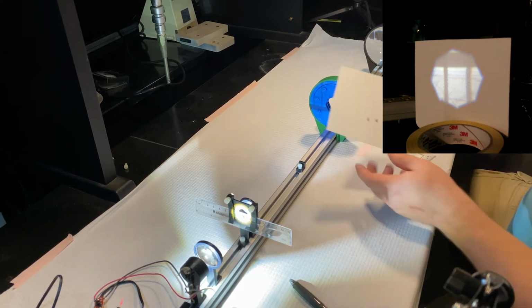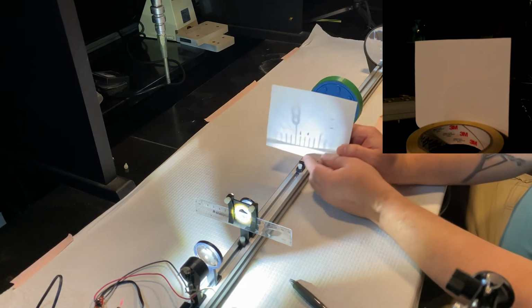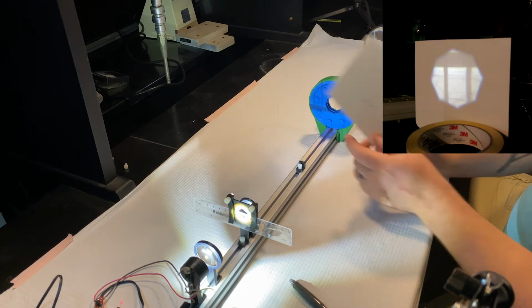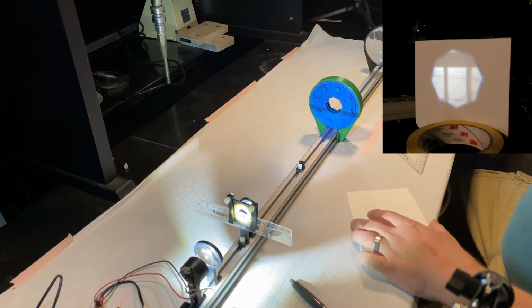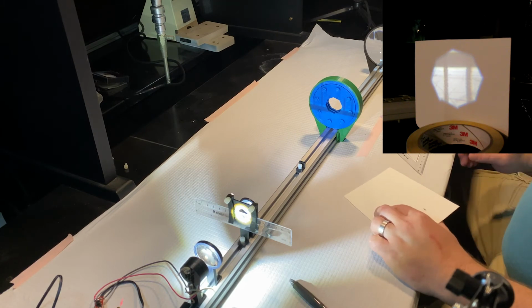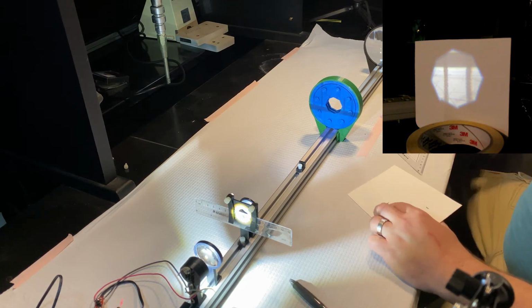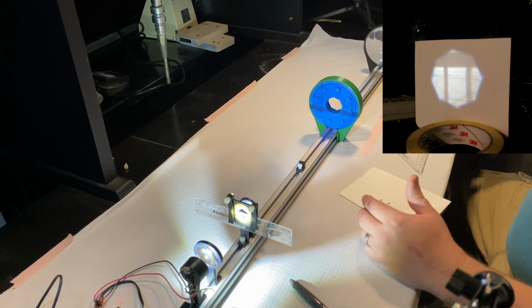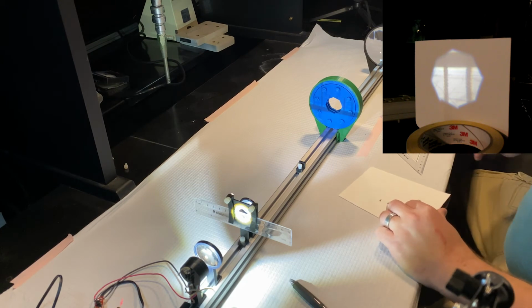We have a focal plane here that is showing these gradations. And then further down, we have another focal plane that is showing what looks like an even more magnified view of these gradations. So let's first try to describe this image. It's a little bit magnified, more so than we did in the last part of this lab.